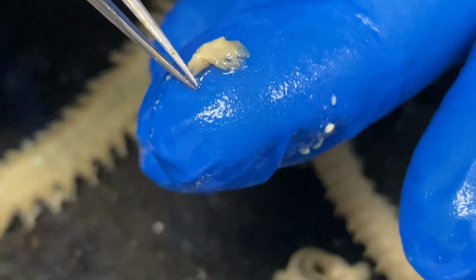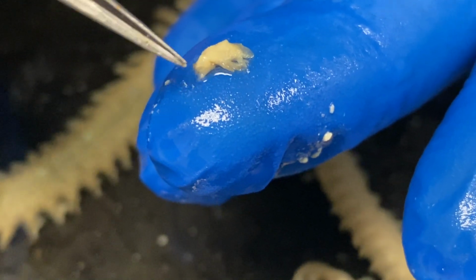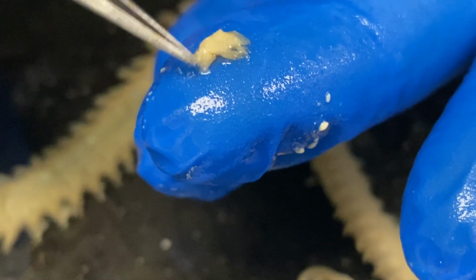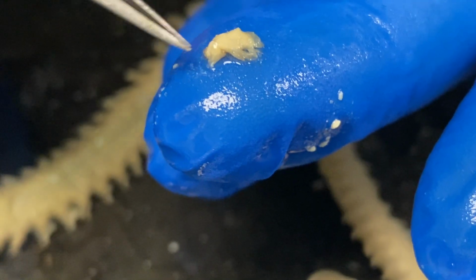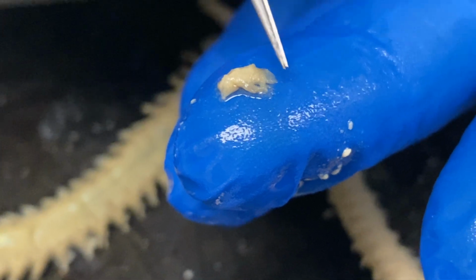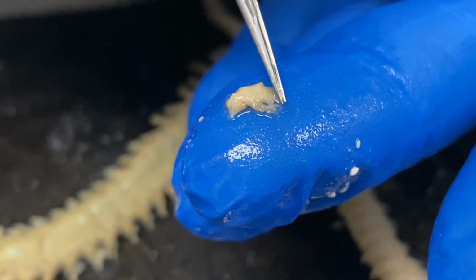If you can just catch it right down here, this would be a ventral cirrus, kind of a sensory appendage or sensory body tissue extending down there. And then just at the top right there, you can see its counterpart, the dorsal cirrus right there. Okay.